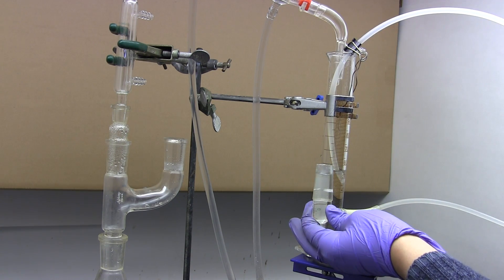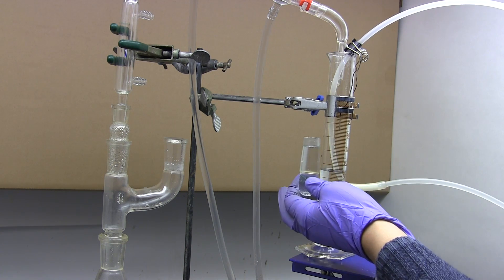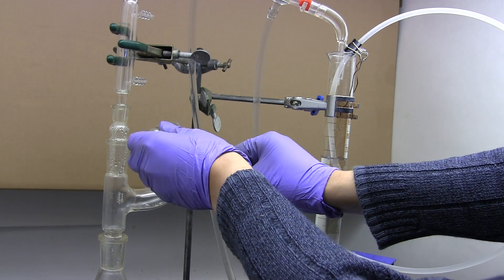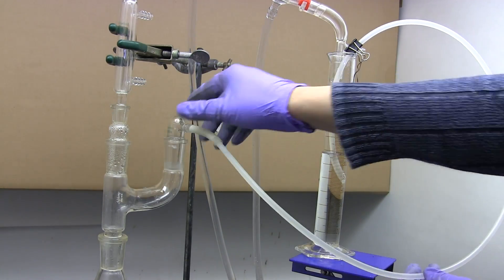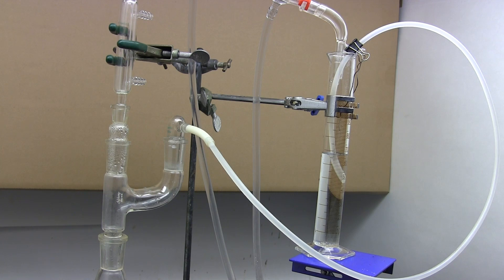Once the siphon is achieved, if you move around the hose adapter filled with liquid the level will match the cylinder as the siphon maintains balance. At this point reinstall the hose adapter onto the Claisen adapter. It's alright if some air now appears in this end of the tube. The lower midpoint of the tube should prevent it from creeping up to the highest point. It's vitally important that air never gets into this highest point or the siphon will be broken.